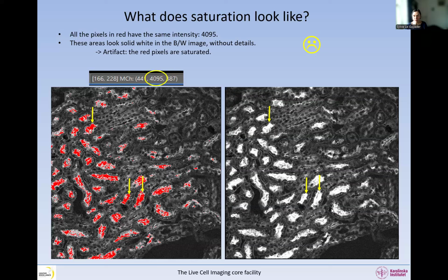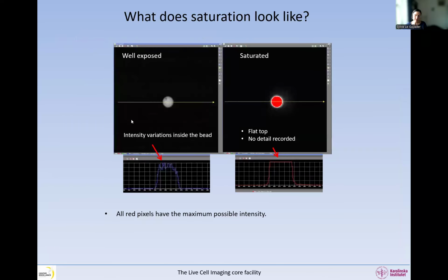This is what it looks like without the saturation mask. This is an artifact of microscopy, and all the pixels that are color-coded in red are saturated. So what does it look like if we look a little bit closer? This is a fluorescent bead, and it is here well exposed. What we can see when it's well exposed is that we have some sort of structure on the bead. Even though it's just one bead with fluorophore, there's some sort of structure. This is because our microscope and our objectives can resolve really nice and fine details.